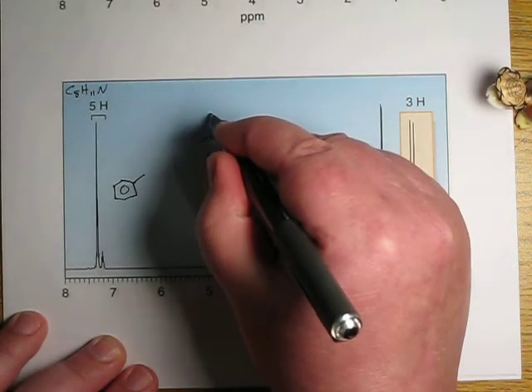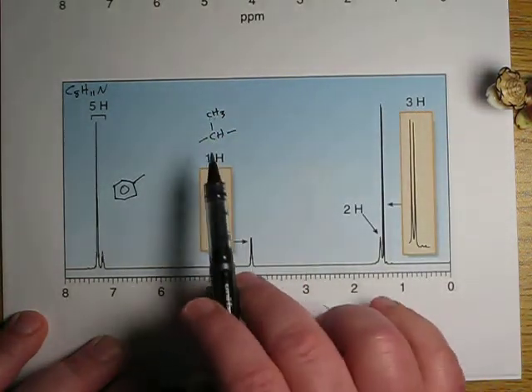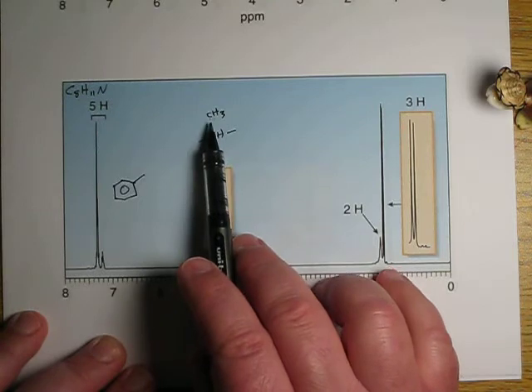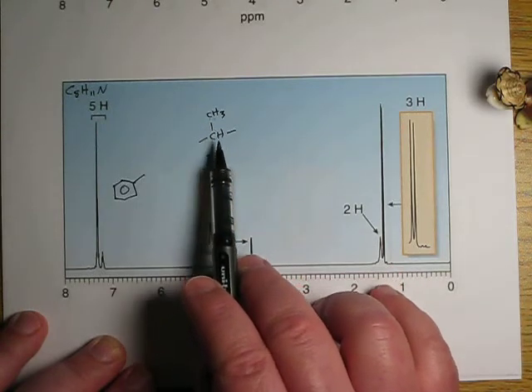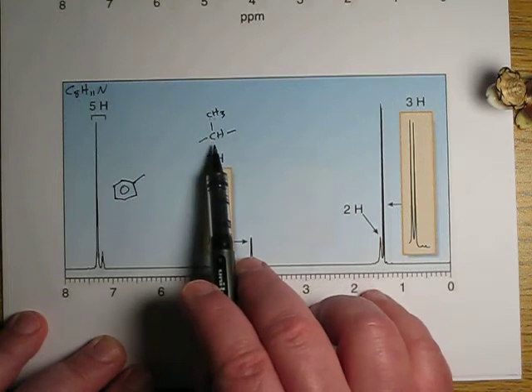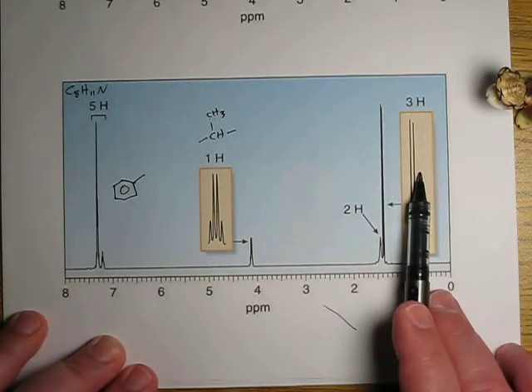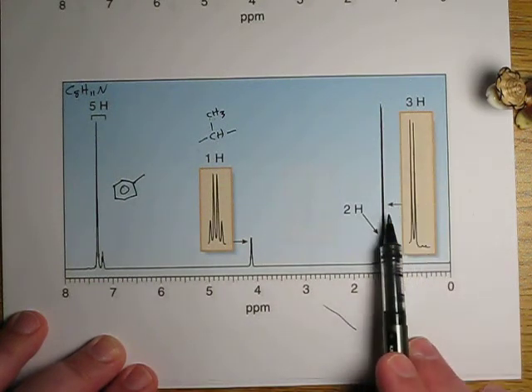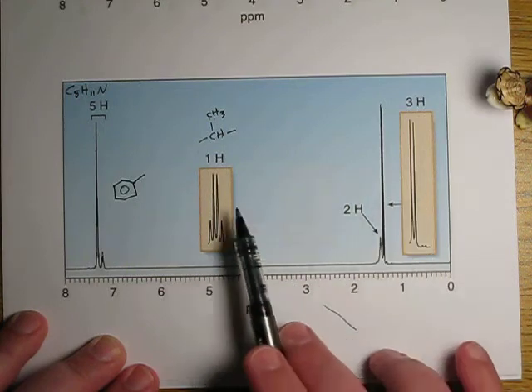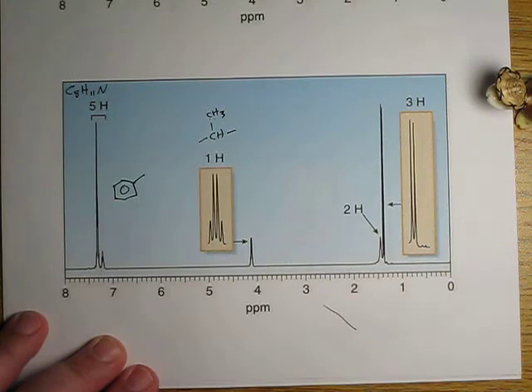So it's probably going to be a CH3. There's our last carbon there. Now, if it is, one would expect a resonance that integrated to 3, split by 1. If this was a CH3 bonded here, we would expect a peak that integrated to 3 and was a doublet. And as we look down here, there it is. A doublet integrates to 3 down here. So that is confirming that that's a CH3 bonded to this CH.